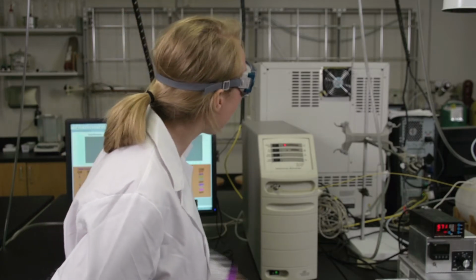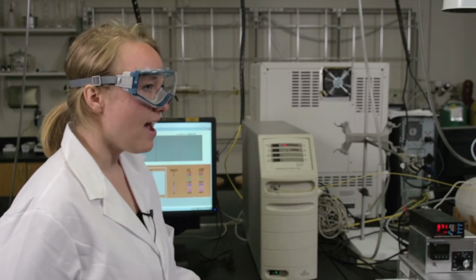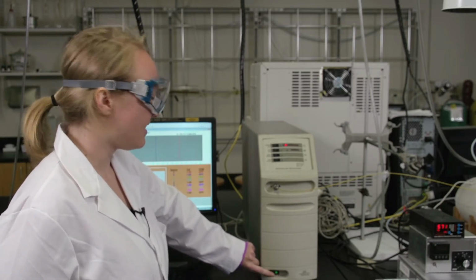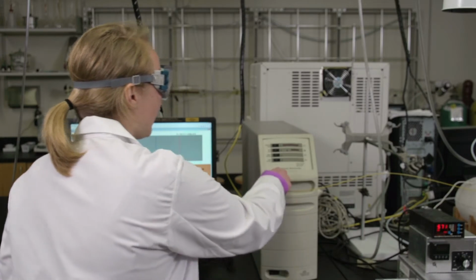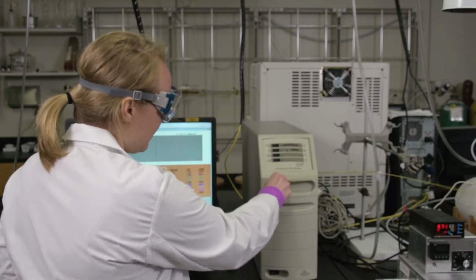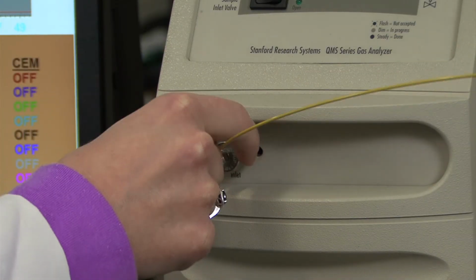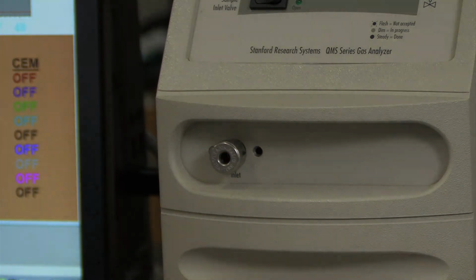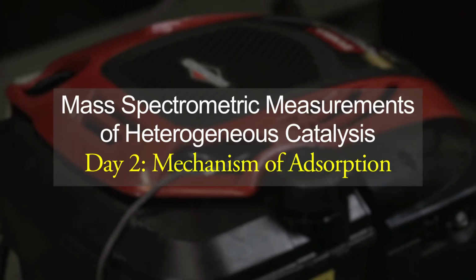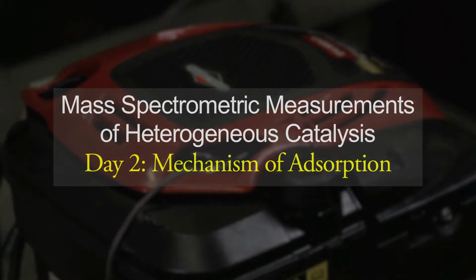And as time goes by, the pressure will start to increase. And then lastly, you can flip the last toggle switch. And then you'll want to disconnect the inlet valve. So you can twist the knob and then pull out the pin of the inlet. That'll wrap things up for day 1.